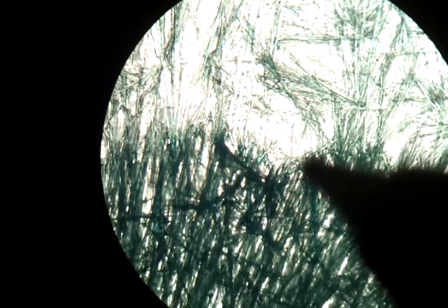When you're looking in the binocular, you can actually see the 3D view of these crystals. They have a very abrupt stop here and a fall, like from a cliff almost, down to the area here, which is very thin. The area here still has crystals, but this area is much thicker and it's more hay-ish. These crystals are open in a 3D structure while this is actually growing on the glass plate.